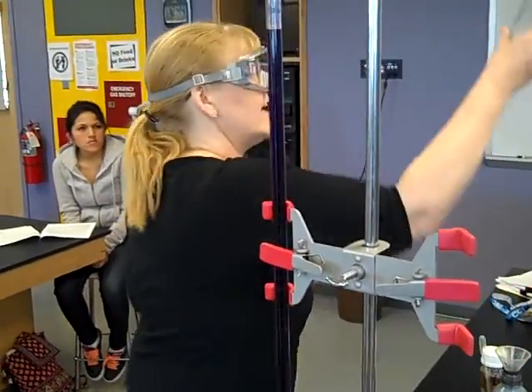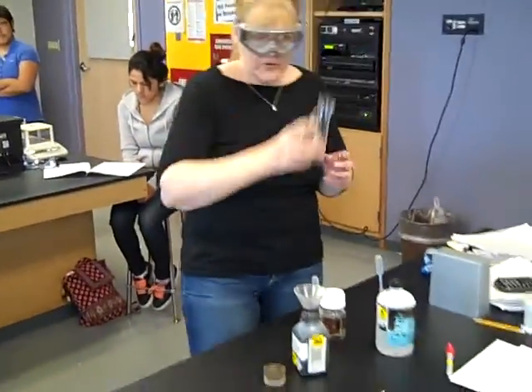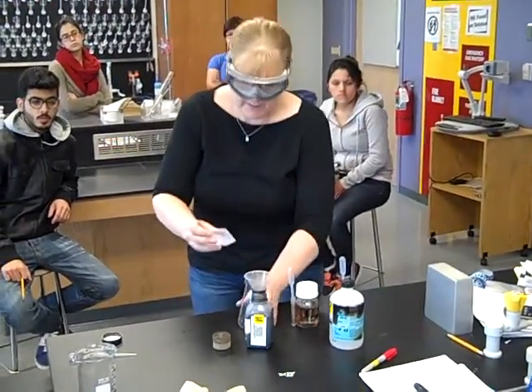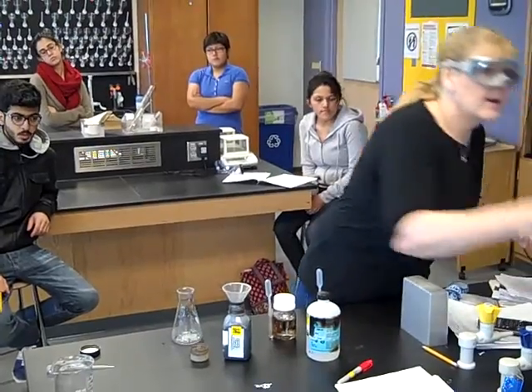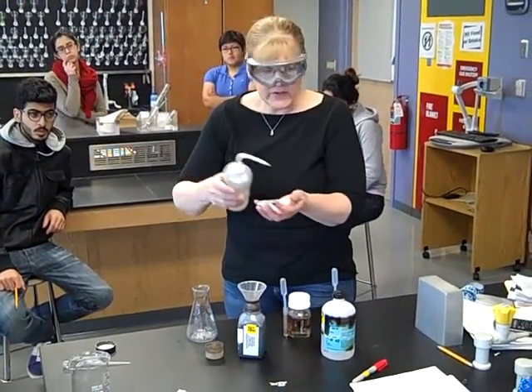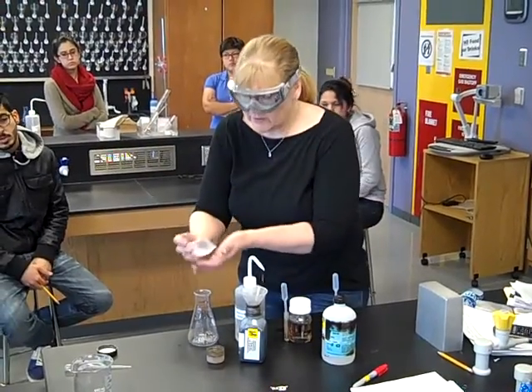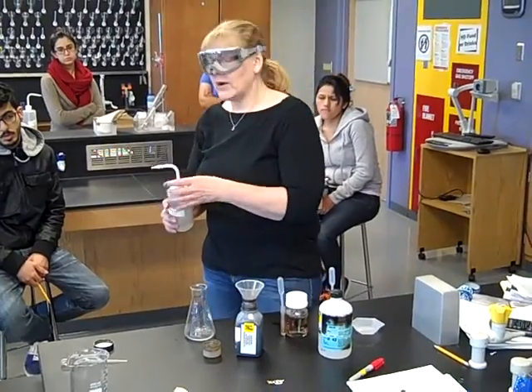To do your experiment, you're going to get yourself a nice clean, but not dry, Erlenmeyer flask — get a large one. You're going to take and add your iron sample. I weighed out 0.298 grams. I'm going to add it into my nice clean Erlenmeyer flask. Because my volume is not relevant, the constant is the mass of the iron. I'm going to spritz a little water in my weighing boat and add it in. Then add about 50 mils of water.